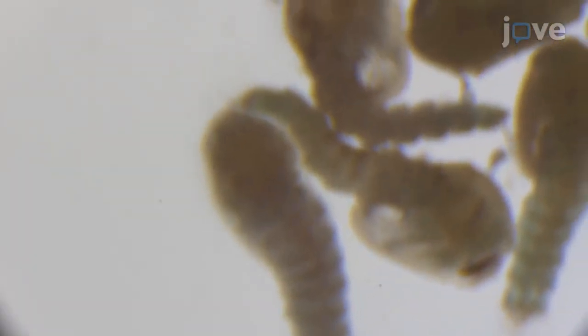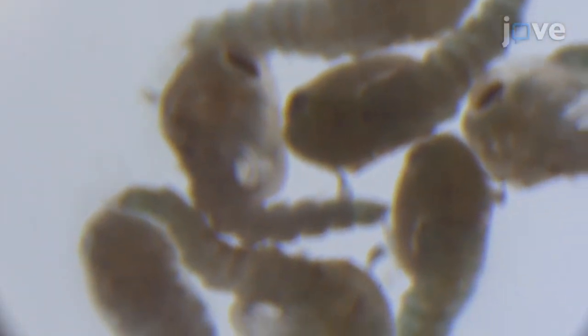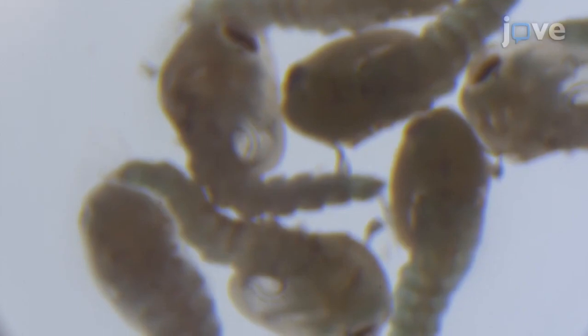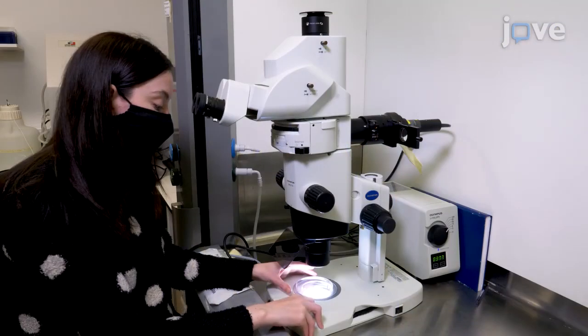Under white light, center the pupae in the field of view and bring them into focus. Turn off the white light and use the fine focus to bring the area of the pupae carrying the phenotype of interest with a visible fluorescent pattern into focus.